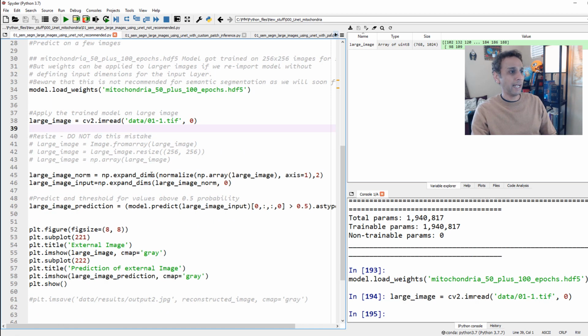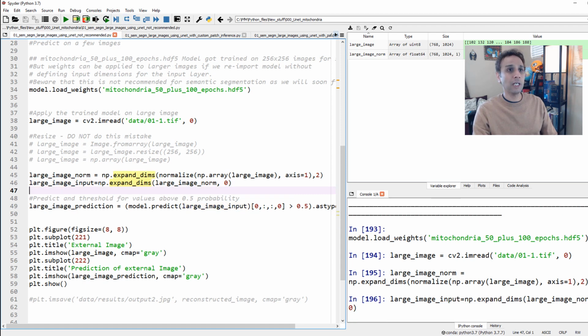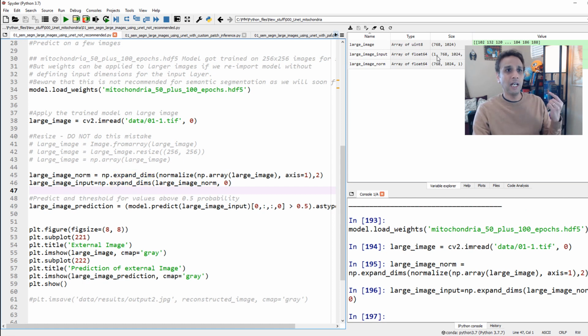So if I just go ahead and do my pre-processing, right? What did we do for pre-processing? First of all, we expanded the dimensions by 1, and also we normalized the values. So if you look up here, my array is of size 768 by 1024 by 1. This is what we have done for training, so I'm doing exactly the same for prediction. And now let's expand the dimensions one more time. So now we have 4 dimensions. This is 1 by 768 by 1024 by 1, right? So this is standard. I'm not doing any tricks so far.